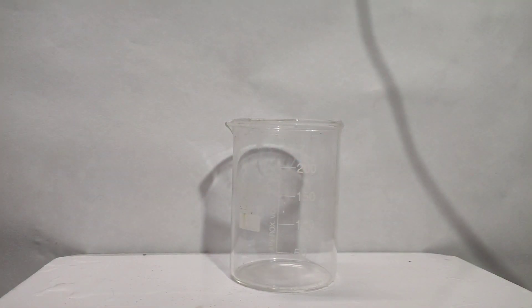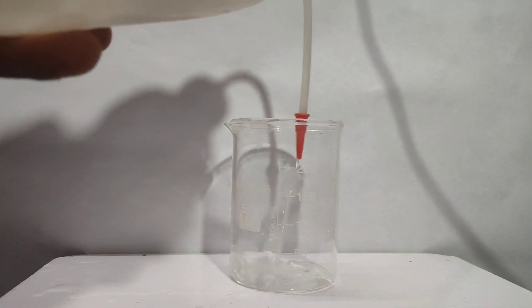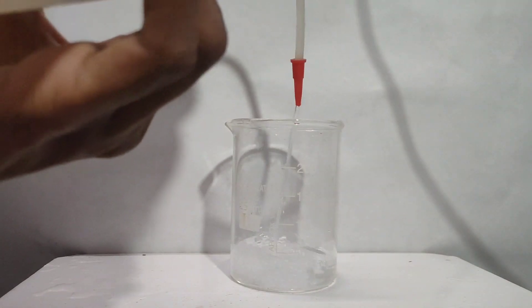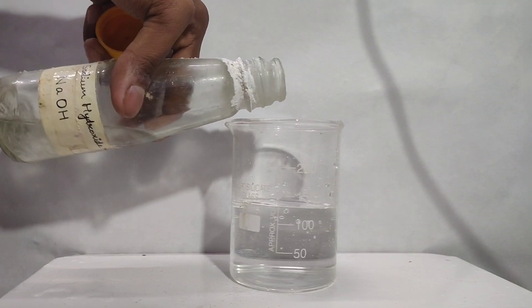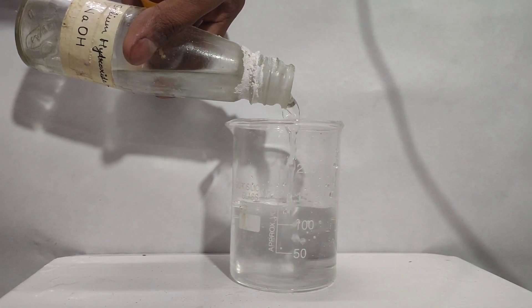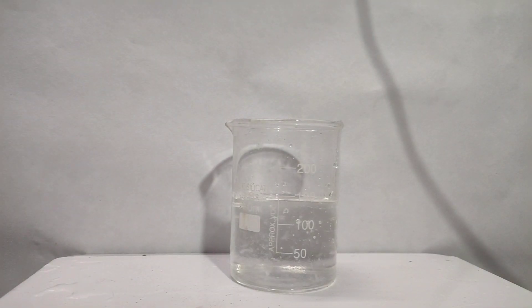First we have to convert the chromium into chromium(III) oxide. For that there are two methods: the electrolysis method and the chemical method. First I will show you the electrolysis method. In a beaker, I took 150 ml water and added sodium hydroxide to make it conducting.